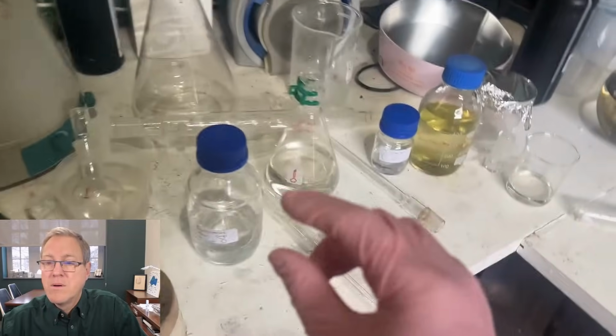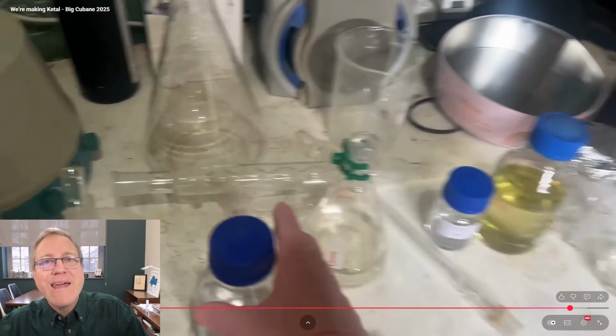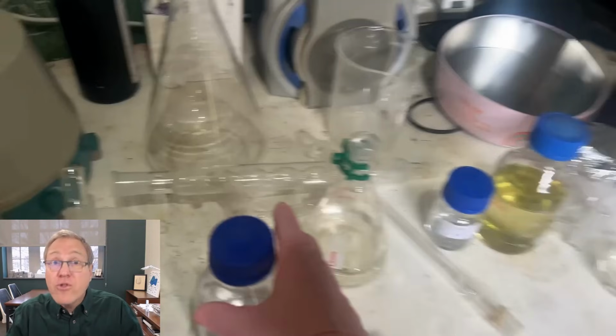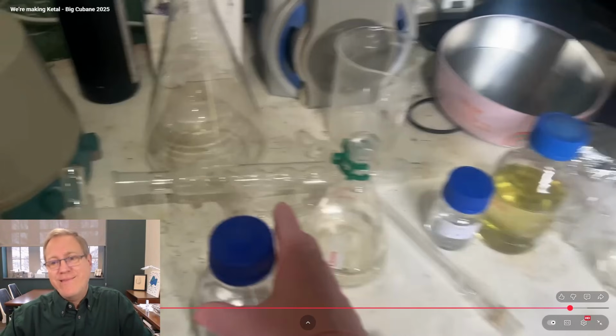But I'm still a little bit disappointed. Listen, organic chemists are never satisfied with the yield. Look, he's doing this reaction in a shed that is also an aviary for birds. Okay, and he got a 46% yield of this ketal, which required careful exclusion of water, and maybe had a leaky piece of glassware while he was doing it. So this is a phenomenal result in my eyes. But organic chemists, we're full of doubt, and we worry about stuff. So he's just playing the role of an organic chemist here.